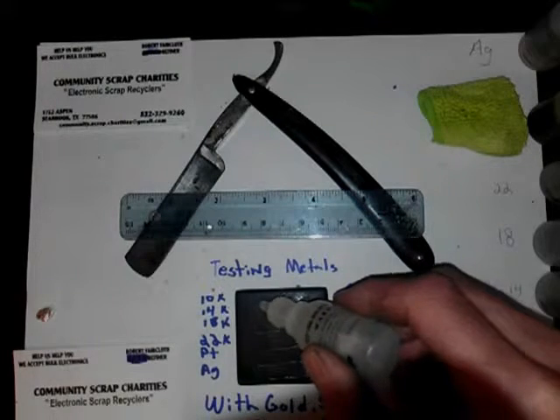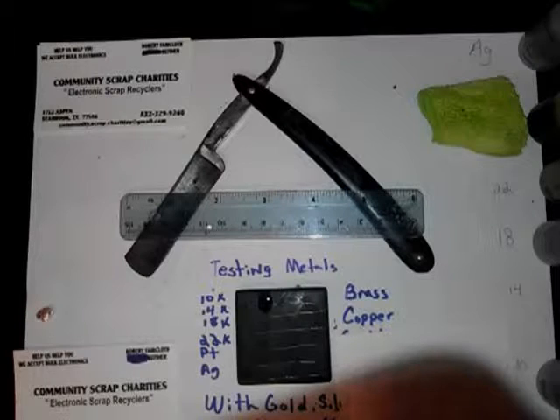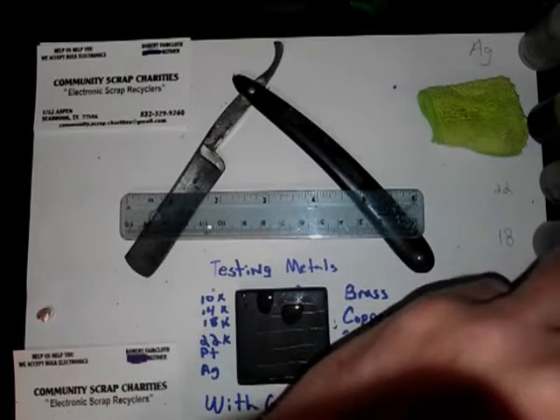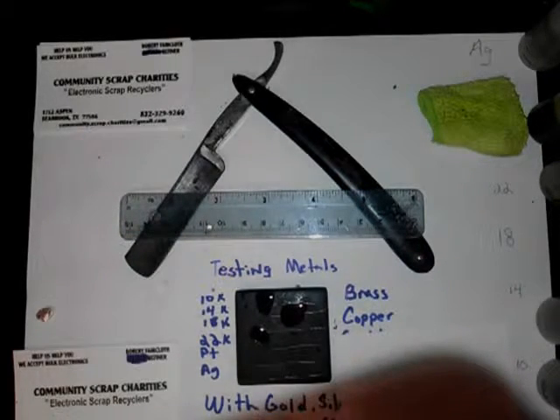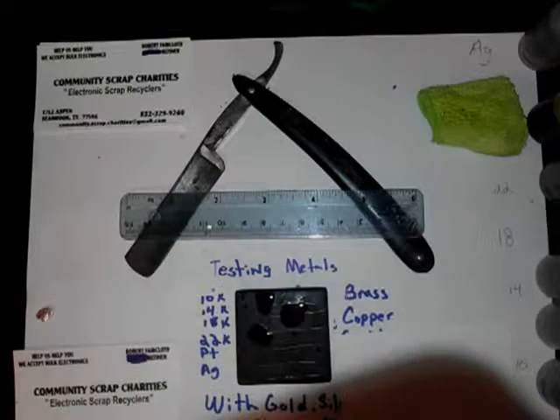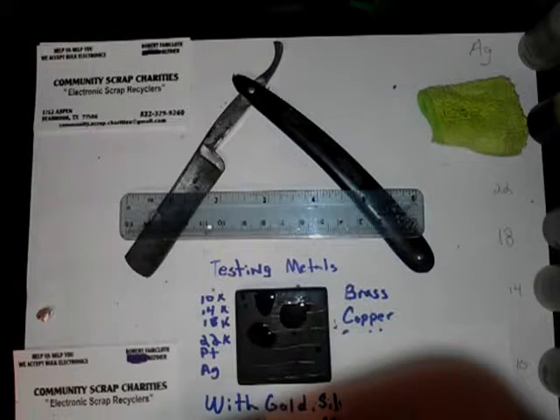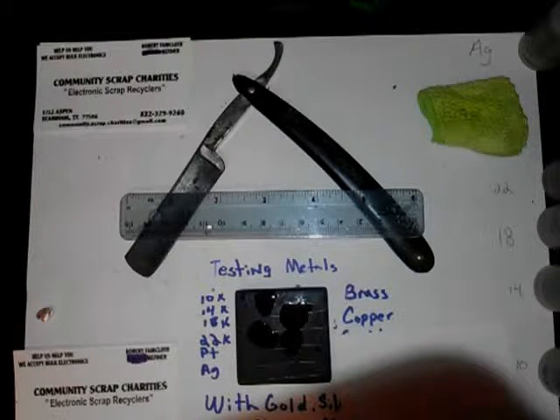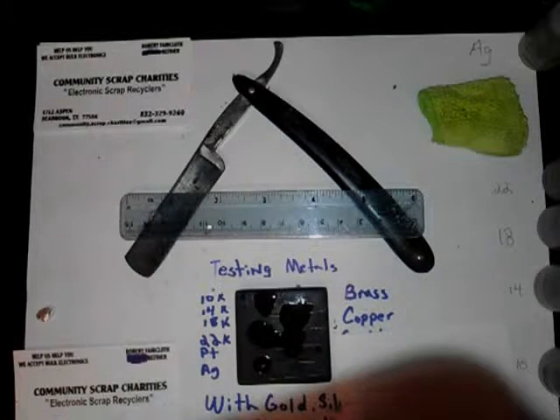Copper with 10 — not much of a reaction. Copper with 14 — eats it right away. 18: as we go up it should eat right away. Yeah, it looks like as we're going up all of them pretty much — that's 18. There's 22. 22 doesn't seem to react very well if it gets too high, but we did kind of see the difference in color.